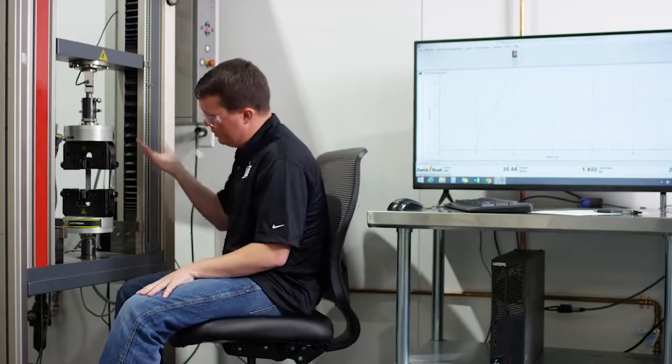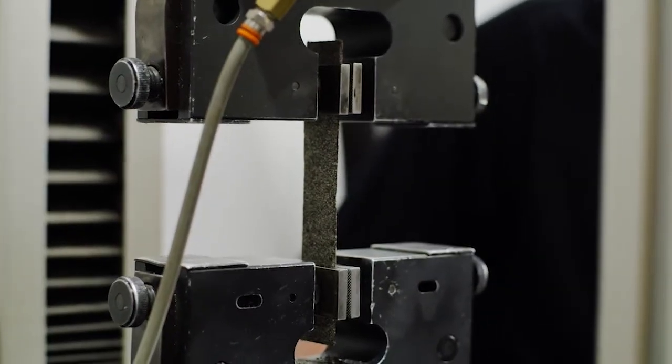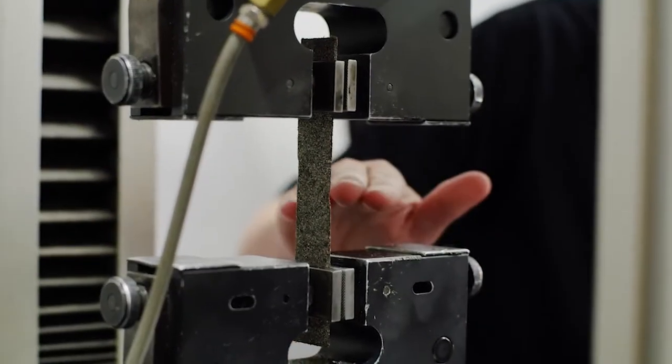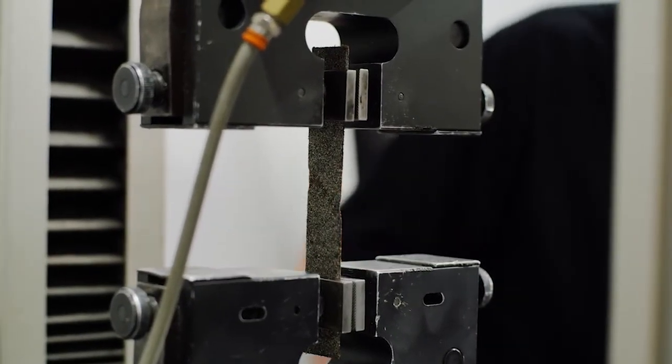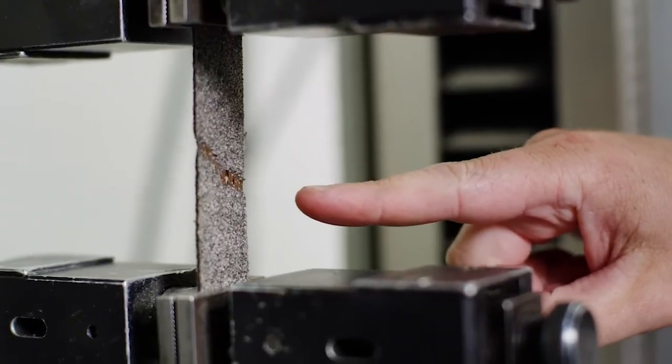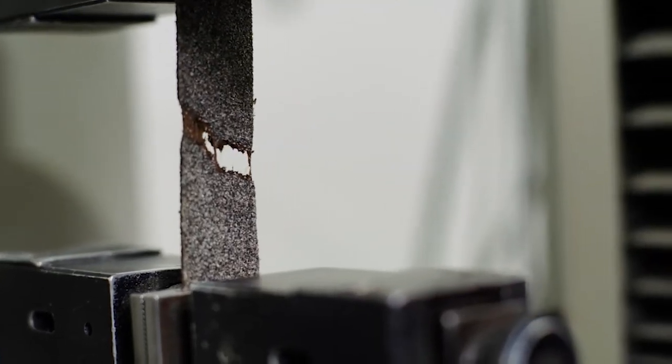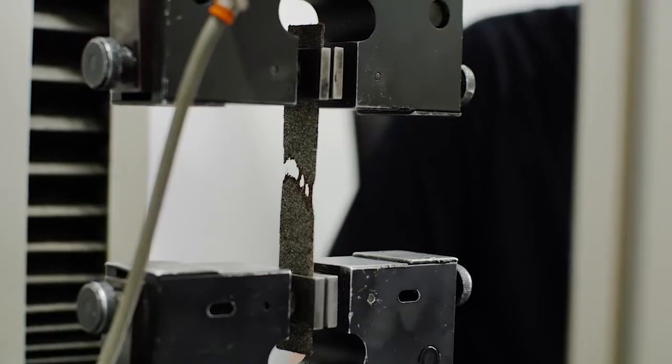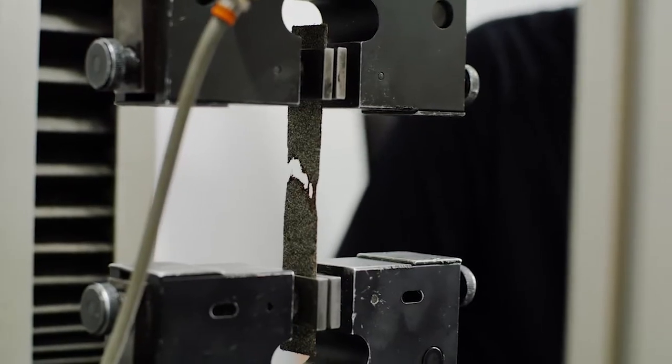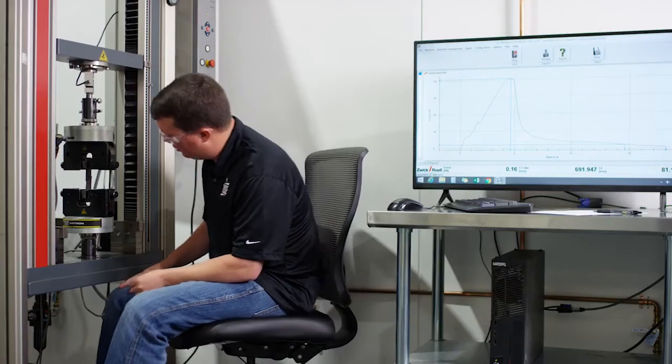If you watch here, start to apply the load, you're going to see that reinforcement. It's broken. Seen a little bit of elongation there, but as you can see quickly, we're starting to see that blend tear. Now we're at about the ultimate elongation point.